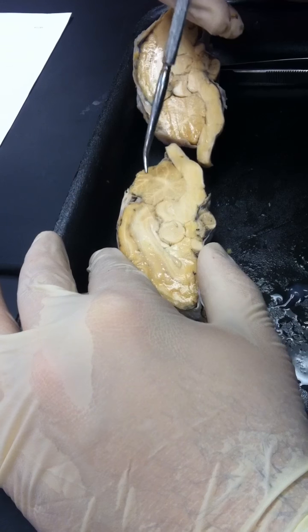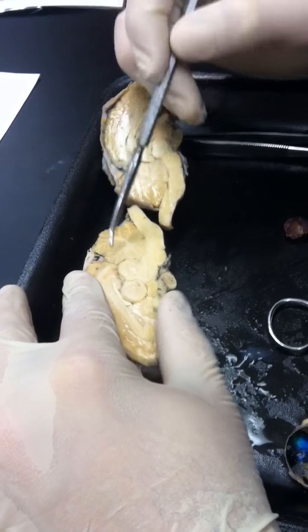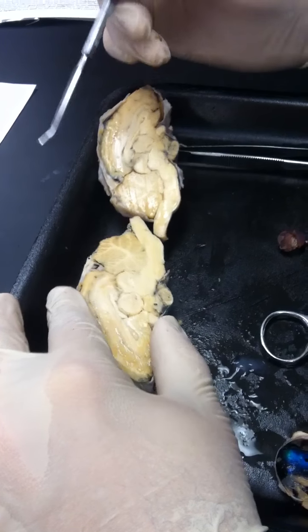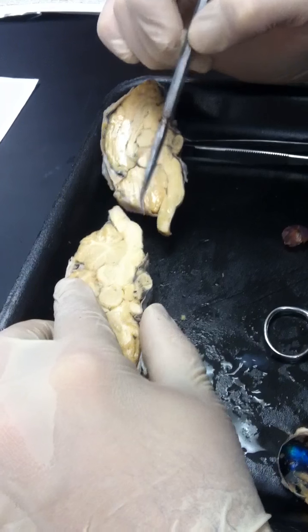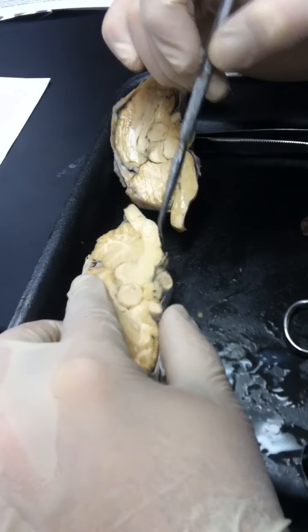So I said, what type of tissue is this? That would be white matter or gray matter. All right. Now, so you're coming up again. This part is spinal cord before it gets thicker. With this first little bump, that tells you your medulla.